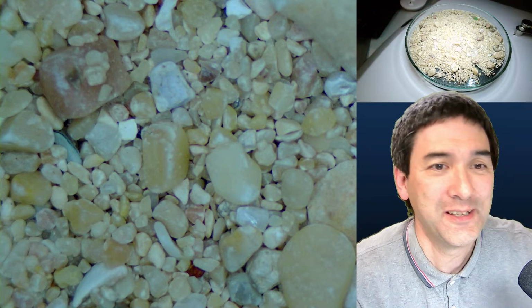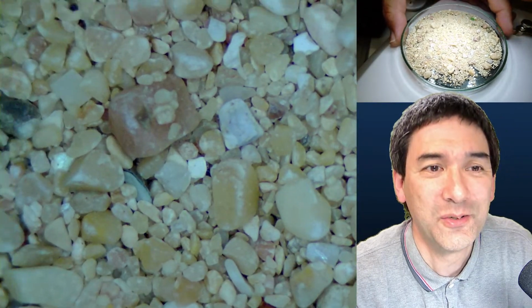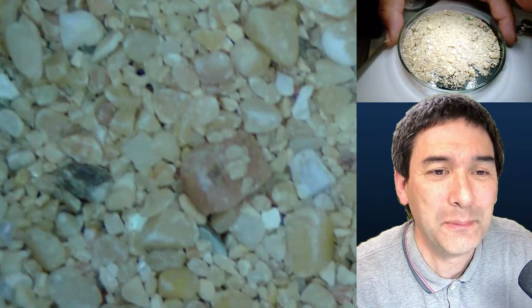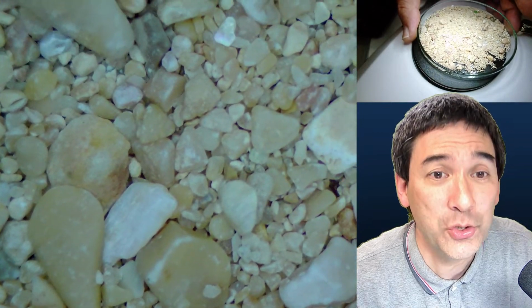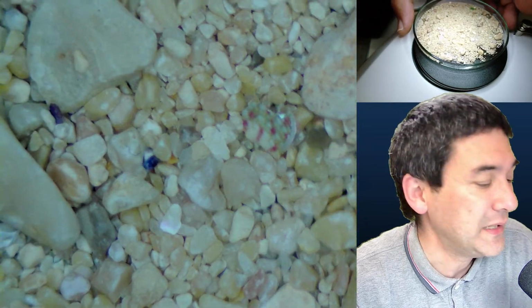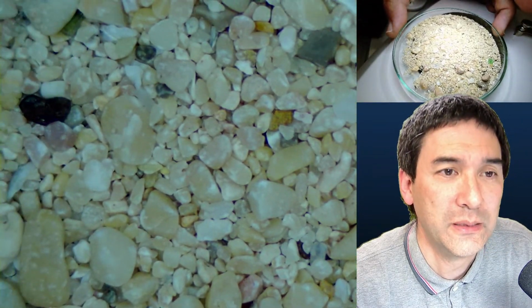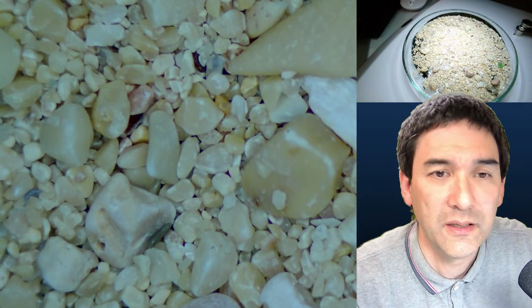Oh, by the way, before I forget, sand also looks very nice. To do a little bit of sand analysis and to look around at what you're able to find in sand. For example, in this sand sample, I found a lot of glass shards and some sea urchin spikes. So sand analysis is also something that I would like to do a little bit here, and for these things, the stereo microscope is really nice.